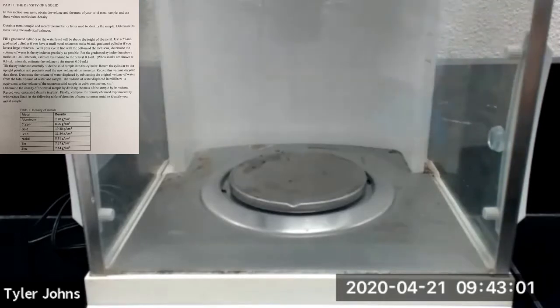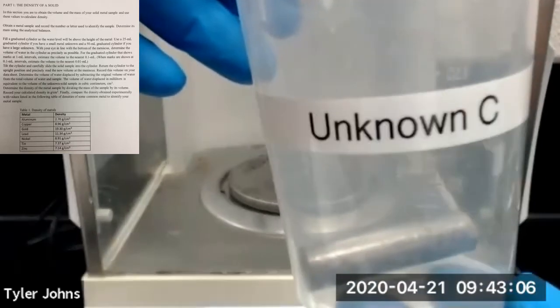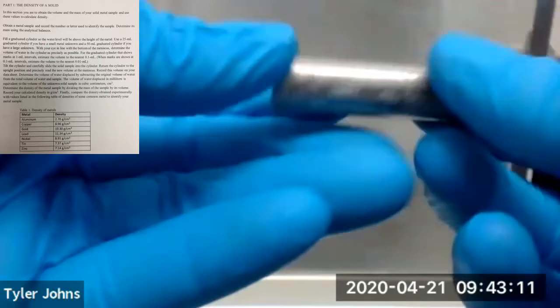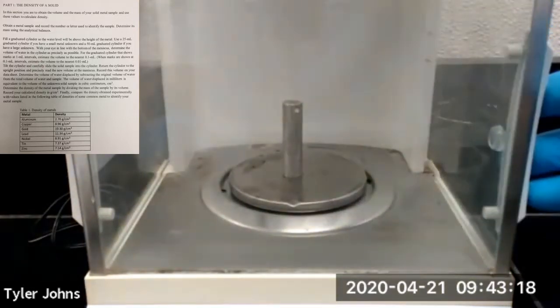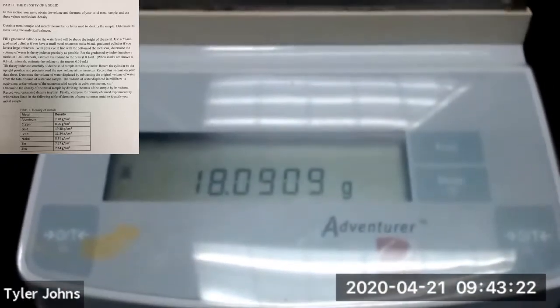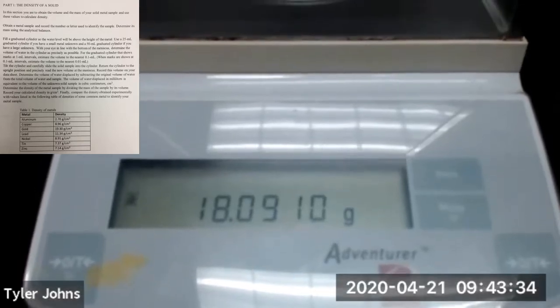Next we're going to move on to unknown metal cylinder C. This is unknown C, and we're going to determine the mass of unknown C. The mass of unknown metal cylinder C is 18.0910 grams.